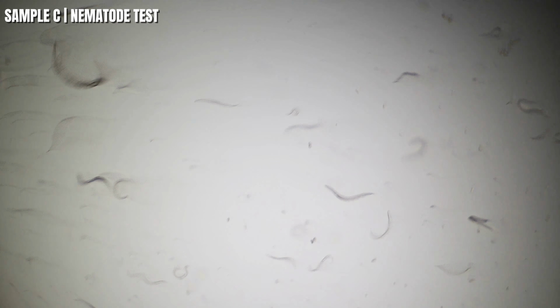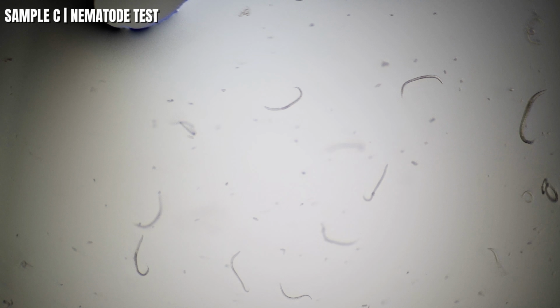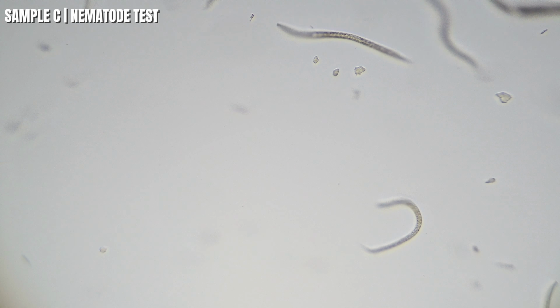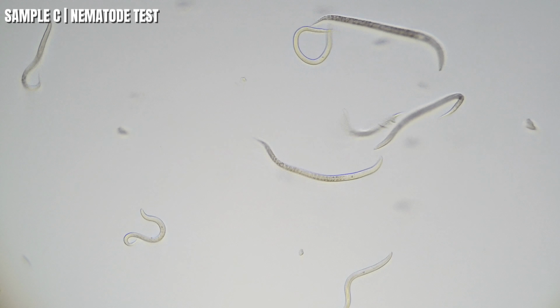There's sample C's whiskey, just introduced. Same results, I think, as sample B. Yeah, of course, they're traumatized. It's a lot of liquor at one time. So yeah, they are slowing up a little bit, I can see. And let's zoom in a little bit, take a closer look. There we are, a little better, but yeah, they're not moving as much. We've got a little more action over here to the left, but they're having a hard time.